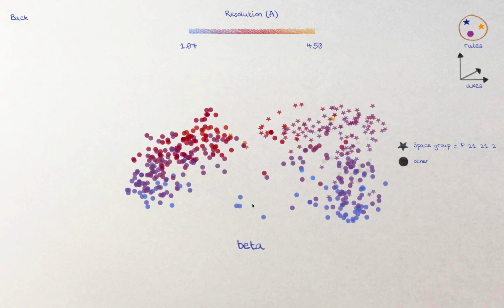So there are lots of ways of playing. I will hopefully make more tutorials, particularly for loading in your own metadata and the various other functions in RoPE, but hopefully this will get you started and being able to play.